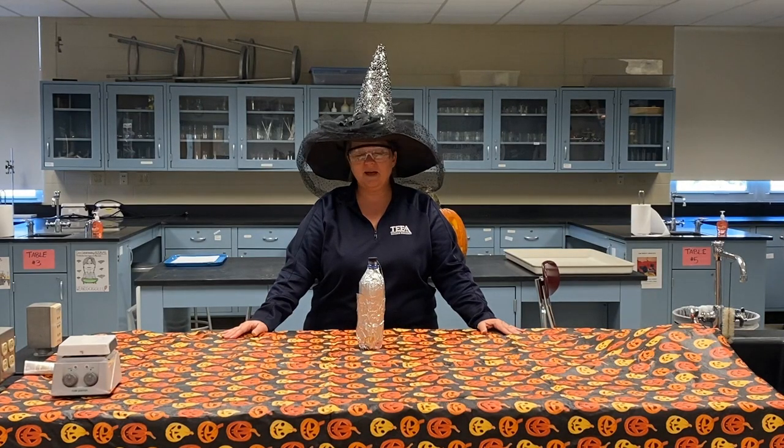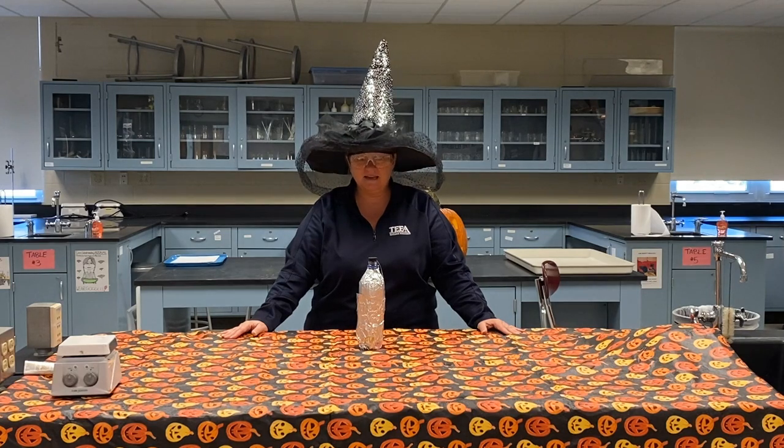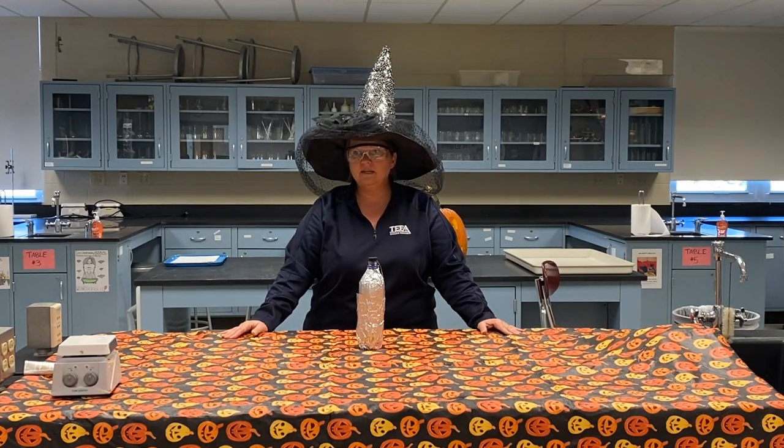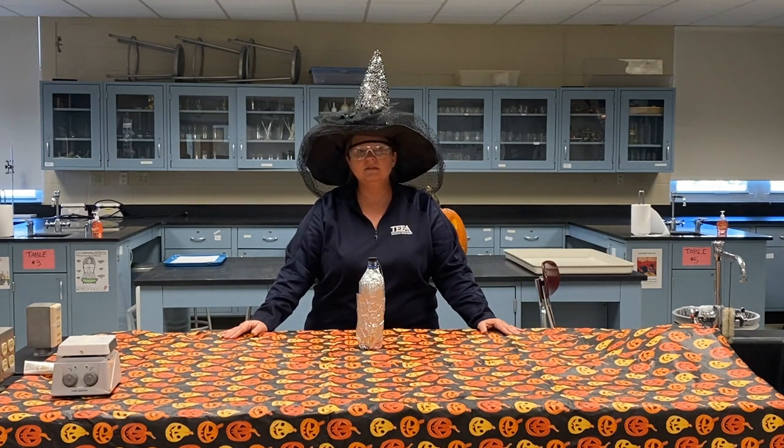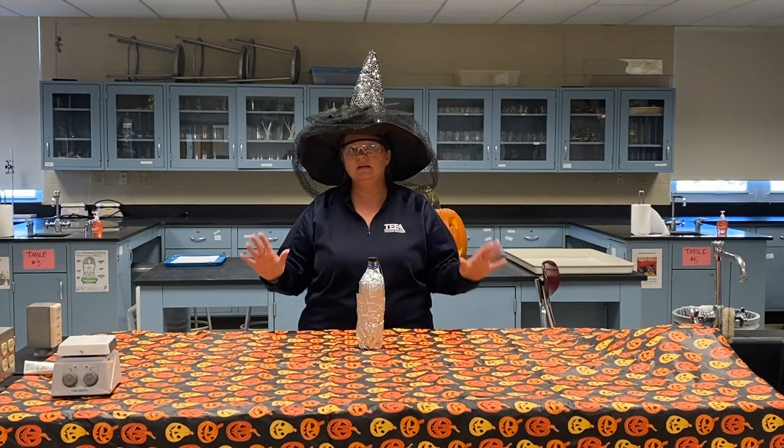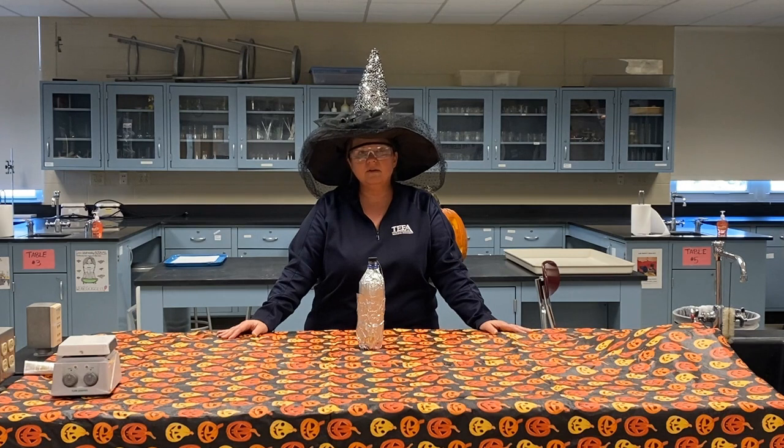Students, and welcome to Halloween Demonstration Day. You're going to see a variety of chemistry demonstrations throughout this video that are going to illustrate a bunch of different types of chemical reactions and processes in chemistry. Now, some of these things you may already be familiar with, and others may seem completely new to you and you just haven't gotten to this part of your study in chemistry yet. That's okay. If we use some vocabulary that you're not familiar with, just sit back, listen, enjoy, and try to take in as much as you can.